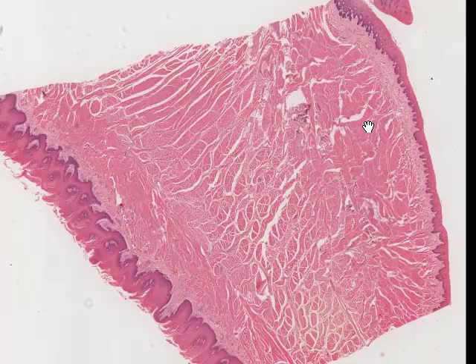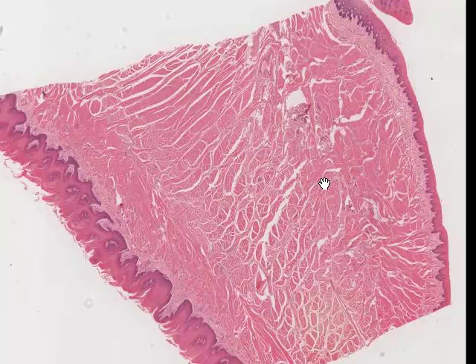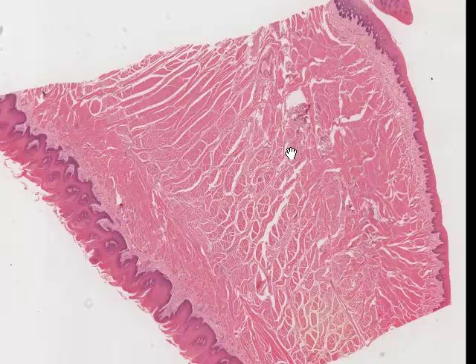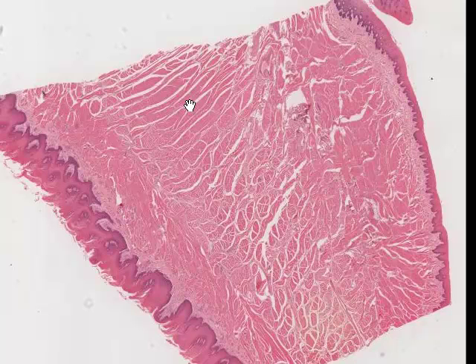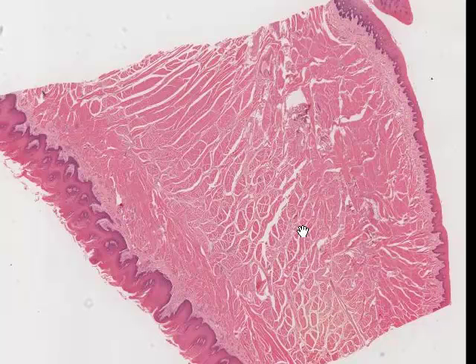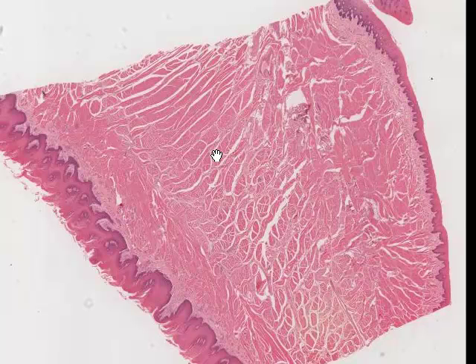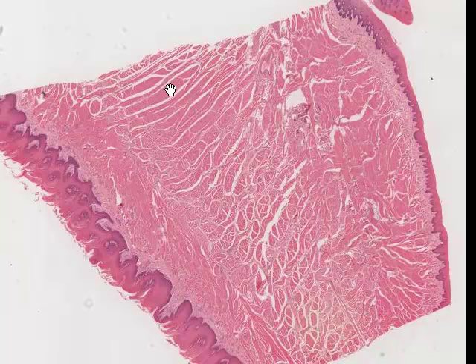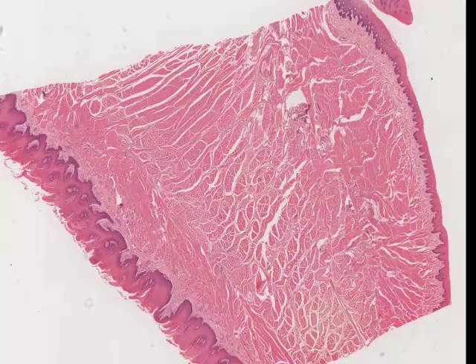The muscle in the lip is principally skeletal muscle, and interspersed among the skeletal muscle we'll see some blood vessels, and although we can't make them out at this magnification, we'll also see some nerve. The muscle is woven at almost right angles, so there are regions where we'll see muscle cut broadly in longitudinal section and other places where we'll see skeletal muscle cut in cross section.